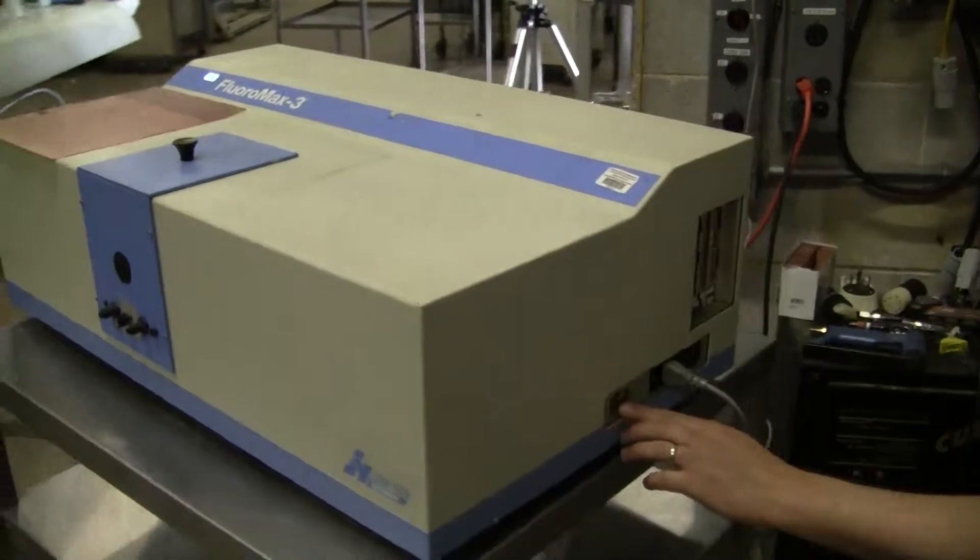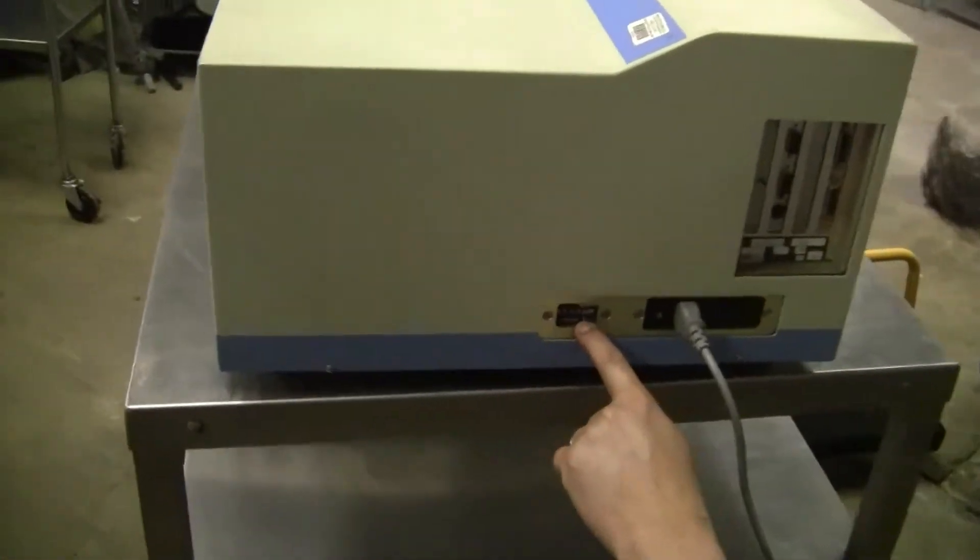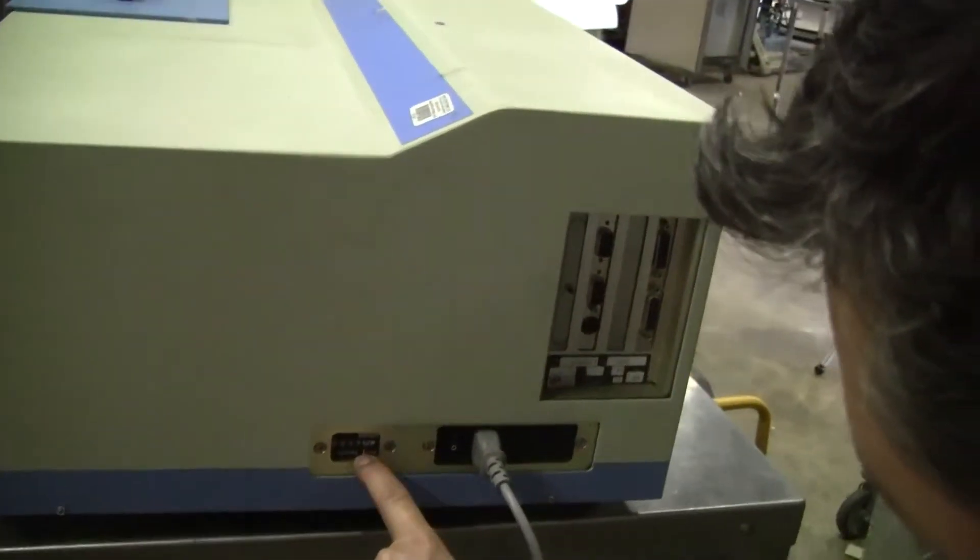While we're waiting, the unit has 59, it looks like 0.8 hours on it.